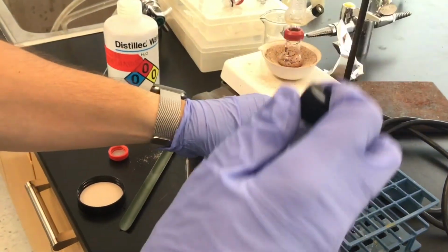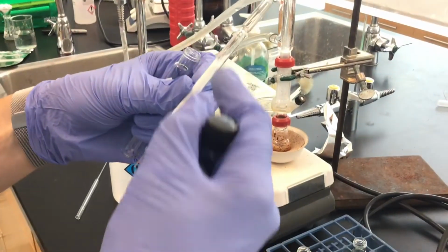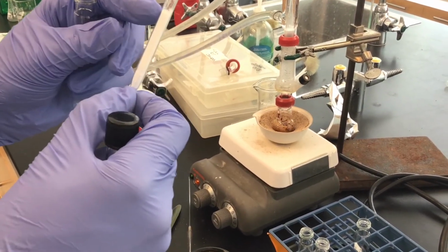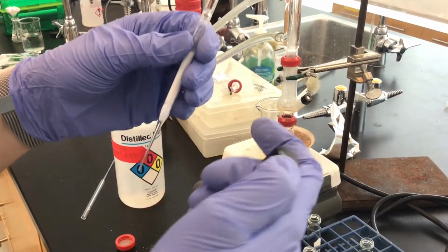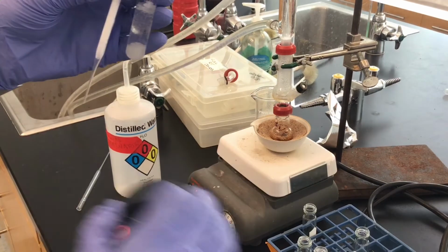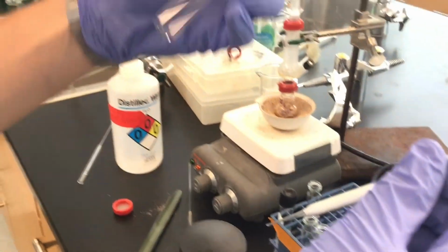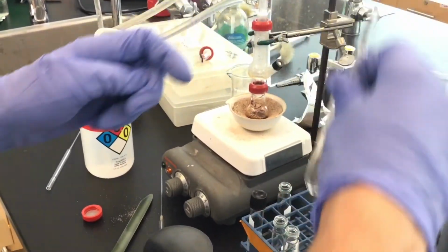All right, so now the last line of defense is to use a column of sodium sulfate. So this is a 5 3/4 inch pasteur pipette. There's a little bit of cotton here, and then above it is a column of sodium sulfate. So this is going to do two things. It's going to dry the organic layer even further, and it's also going to act as a filter. And so I'm going to now recall the fact that I tared my culture tube earlier, and this is where we're going to put our dry organic layer into.